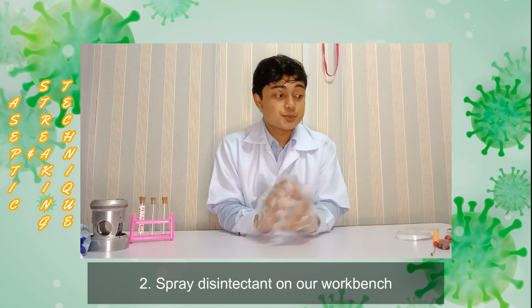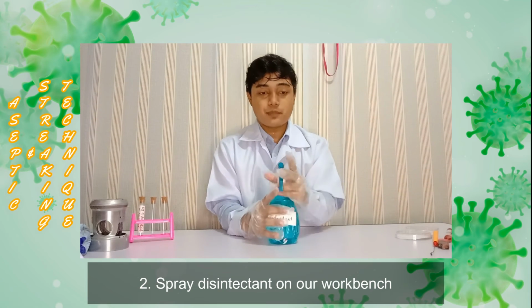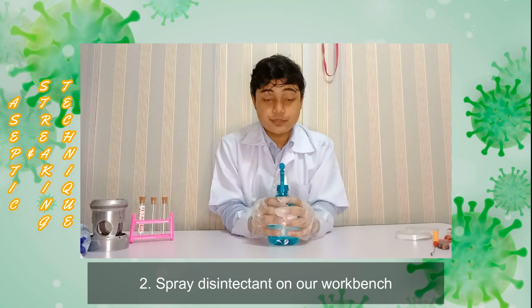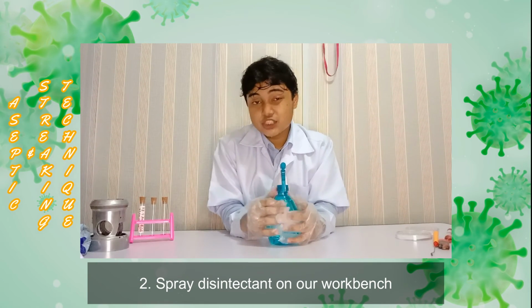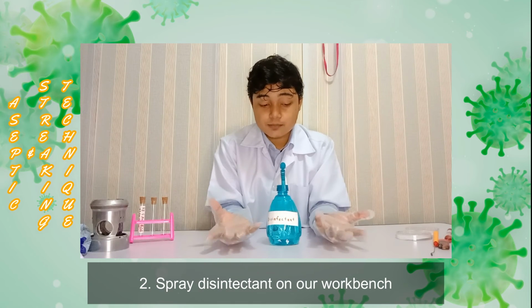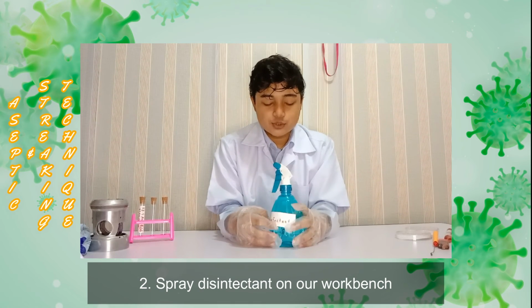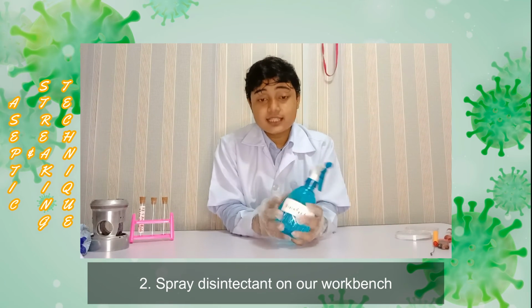And the second, we need to spray disinfectant on our workbench, to make sure there is no dust or contamination before we do the experiment. And after the experiment, we need to make sure there are no microorganisms from our experiment on the workbench. This is to prevent infection and contaminating ourselves.